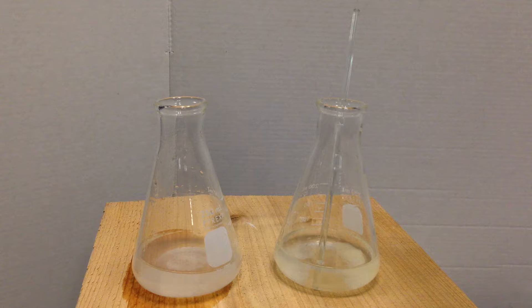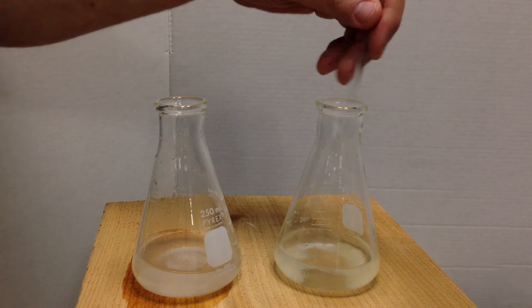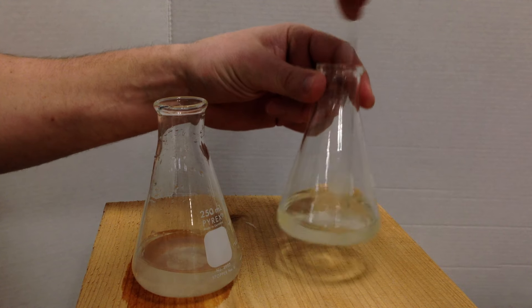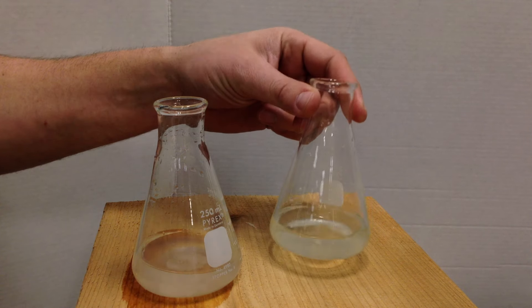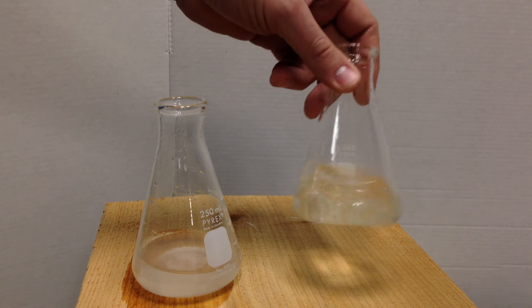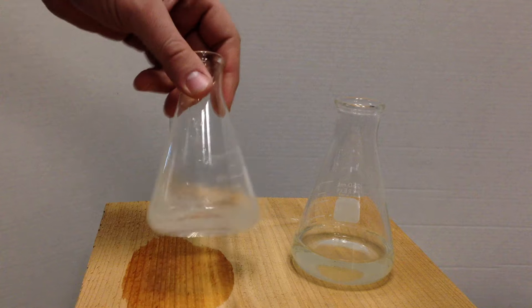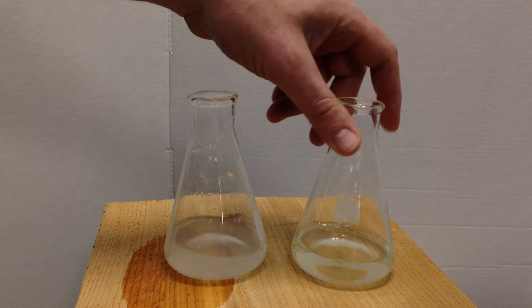And both of these solutions, or both of these salts, are soluble in water. So I stir and I have two aqueous solutions. You can see through them and you can see the solids have now been dissolved.